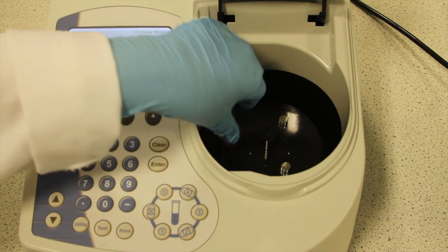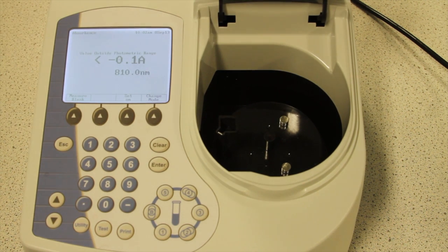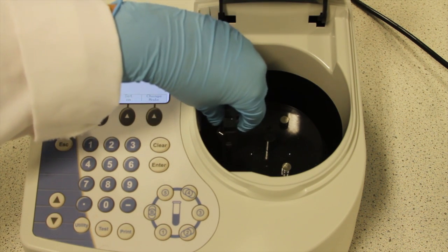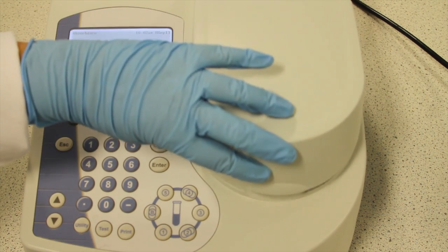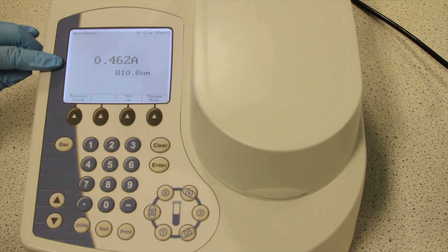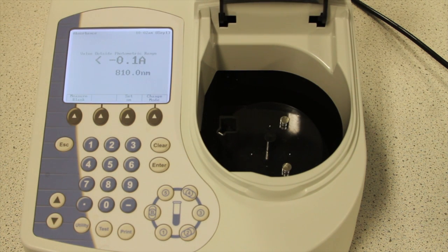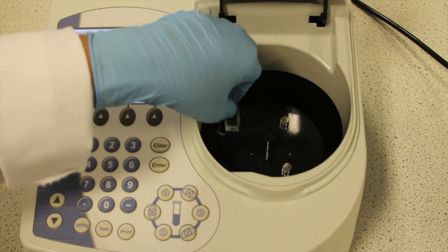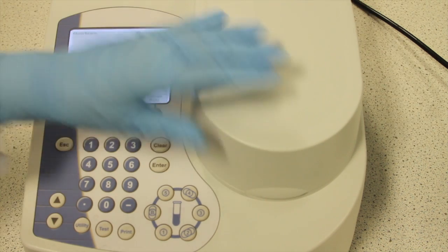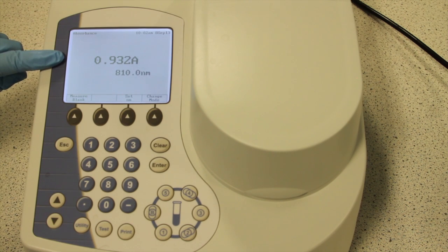Now open the lid and remove the cuvette. Insert the cuvette containing the solution to be measured — in this case, 25 millimolar copper sulphate solution. Here you can see that the absorbance of this solution is displayed as 0.462. Now you can continue to read the absorbance of the other cuvettes — in this case, the 50 millimolar solution. Here you can see that the absorbance of this solution is displayed as 0.932.